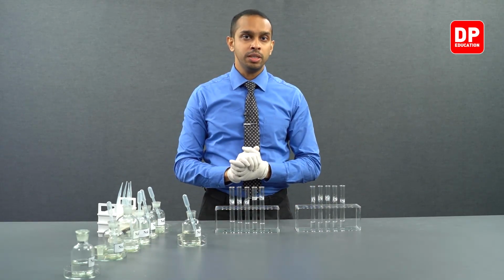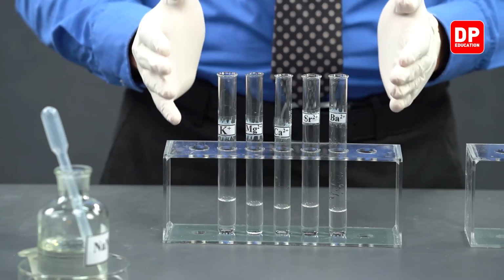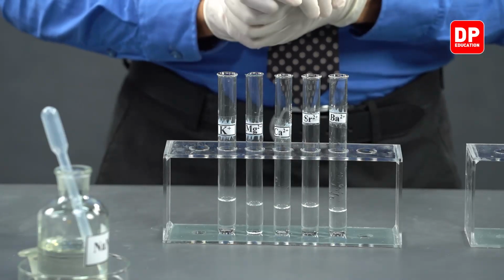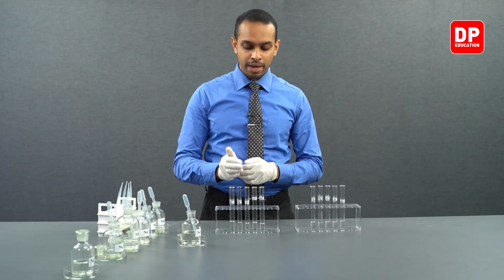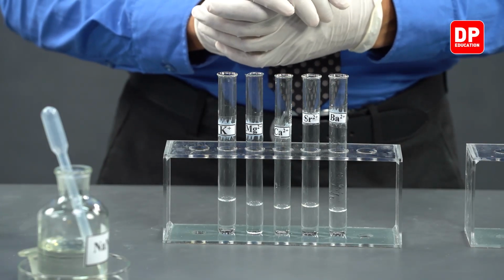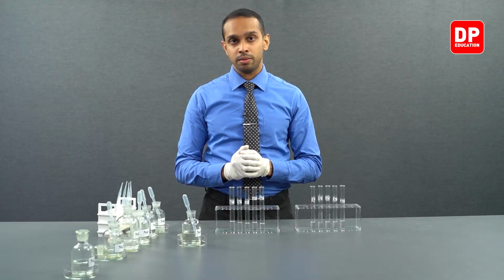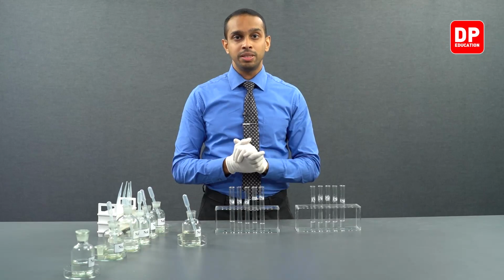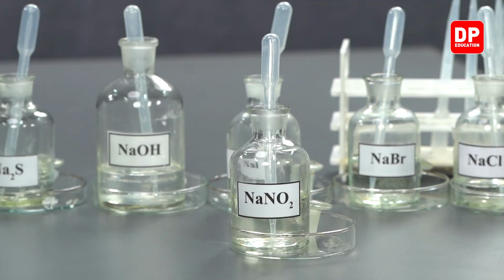With this experiment, we observed that all of the nitrites that we had here were soluble, starting from potassium to barium. When potassium ions, magnesium, calcium, strontium and barium ions were reacted with nitrites, we saw they did not form a precipitate. In fact, both the group 1 and group 2 elements do not form precipitates with nitrite ions.